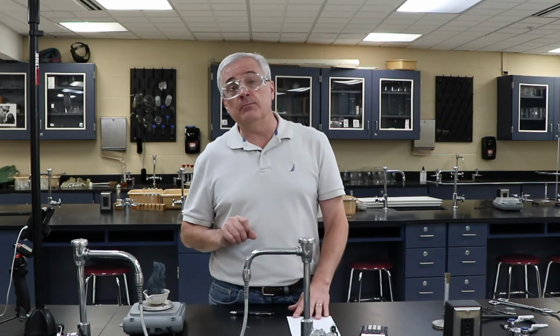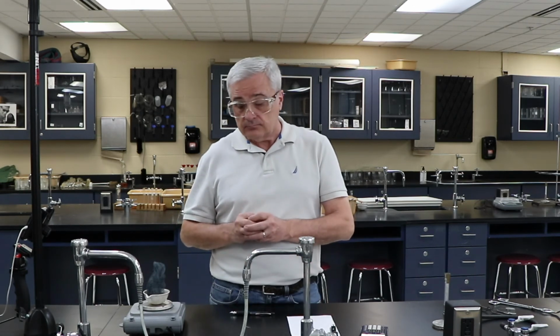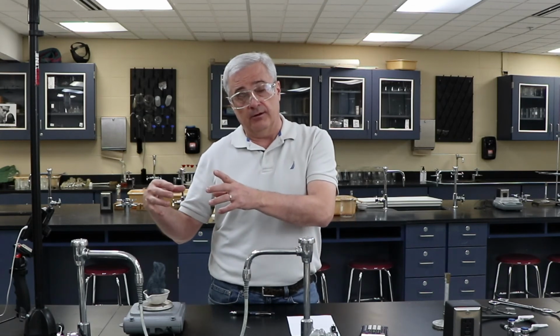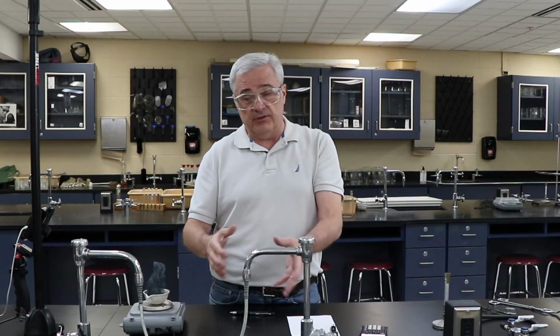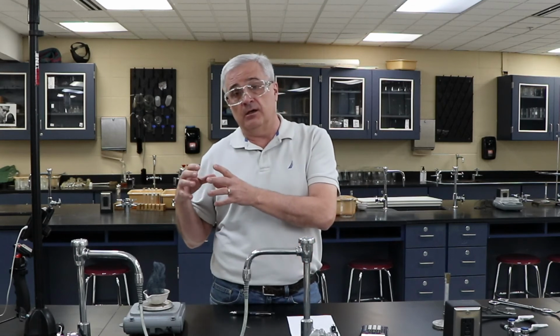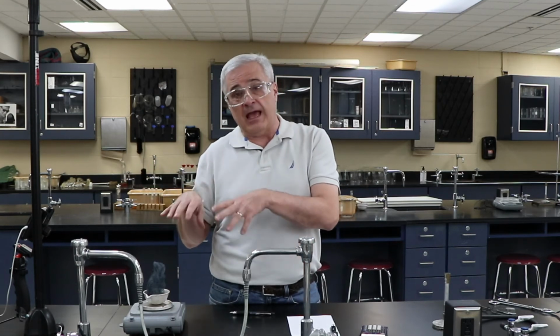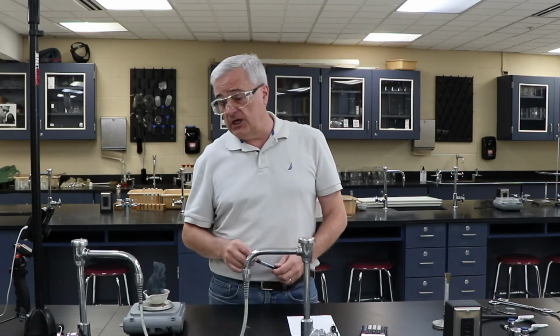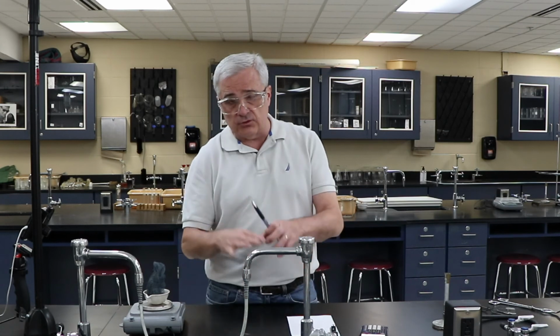If you wanted to do this in a more sophisticated way, you could probably find a way of containing your steel wool better so that you don't lose parts of it off on the table. You could probably find much more accurate results from there and do more of the stoichiometry. So the discussion could include all of the sources of error.